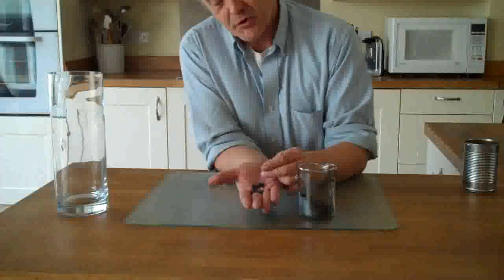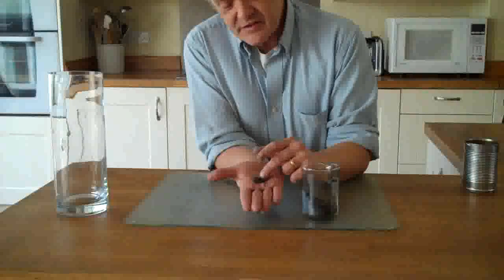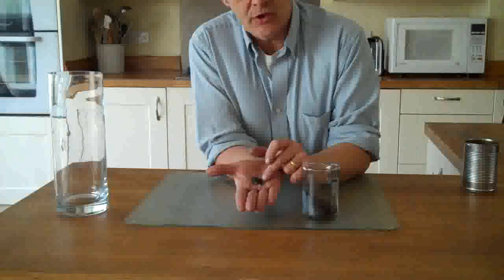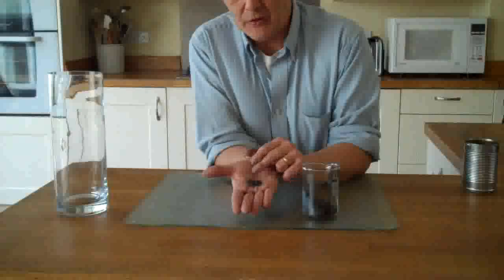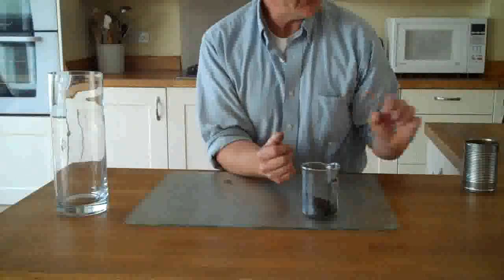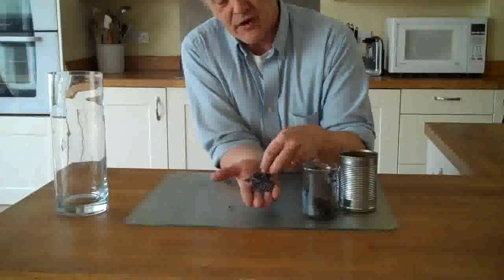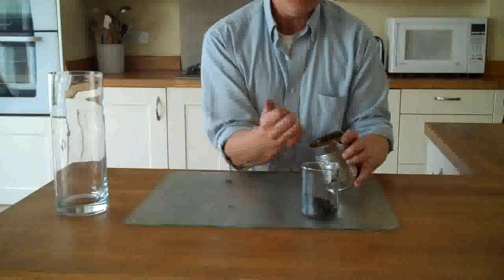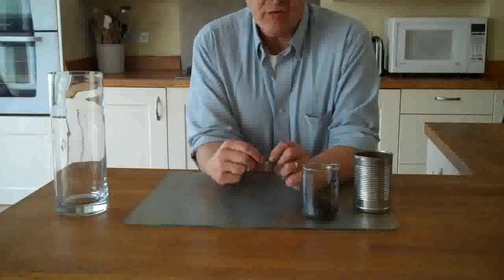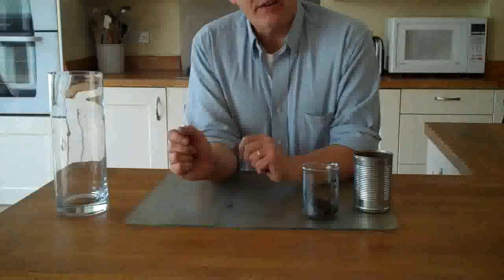This has been dried overnight — I put it on at 60 degrees on an open pan and overnight it dried and formed my intercalation compound. That's your end product, which actually looks surprisingly not very different to graphite. This is the stuff I used in my Super Easy Graphene video — if you drop this into hydrogen peroxide, this is what I used to make graphene. You can also put it into the microwave, and what you get is exfoliated graphite. And if you just put it into a vice and compress it, what you get is a really weird metallic graphite, and the conductivity on that is very impressive indeed — a really useful and interesting compound to make.